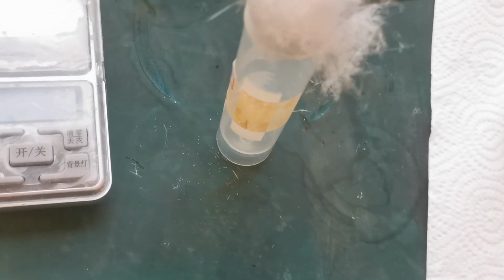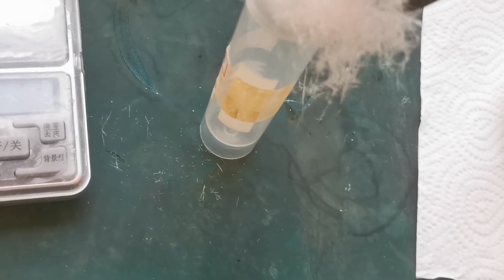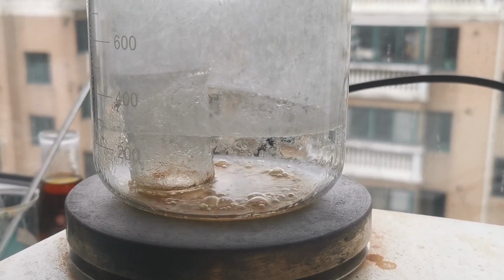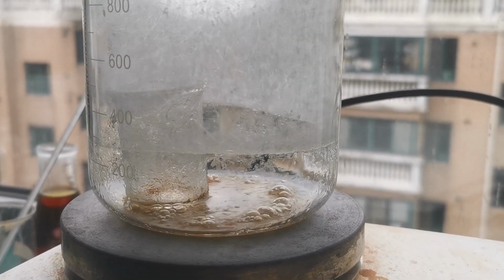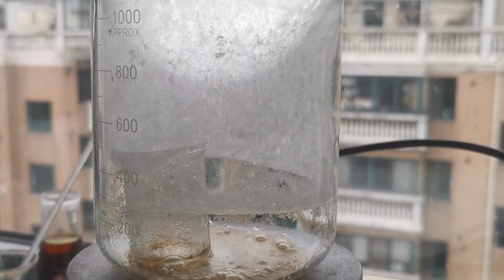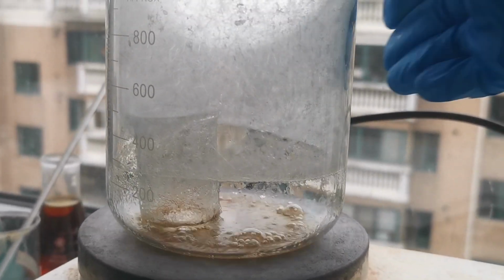The beaker is then placed on the hot plate again, and the process repeated several times until little phthalic anhydride comes out. The annoying part of this procedure is that it is a batch process, and the beaker needs a long time to completely cool down. I'm sure there must be flow process optimizations that make this method much more efficient.